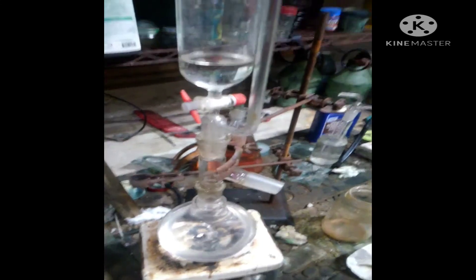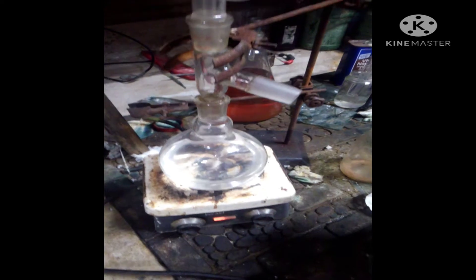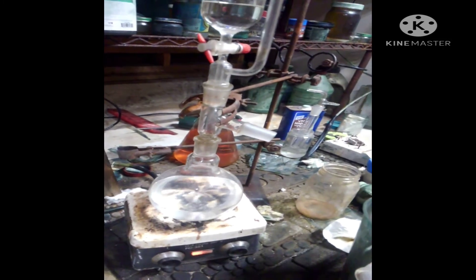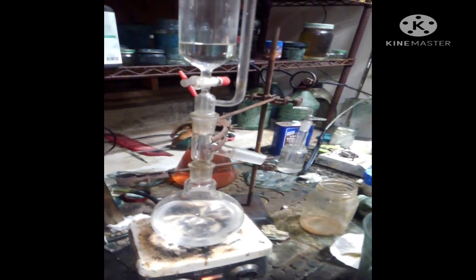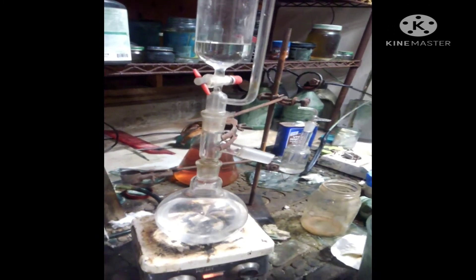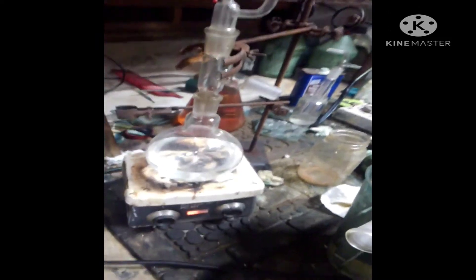I've got my sulfuric acid dripping into the boiling flask really slowly, about one milliliter a minute. The glassware is fused and I wasn't able to get it apart, so I had to head out and just get this set up so it can run itself while I'm gone. This is going to run until the sulfuric acid is completely added, then I'll just let it stir until I get home.